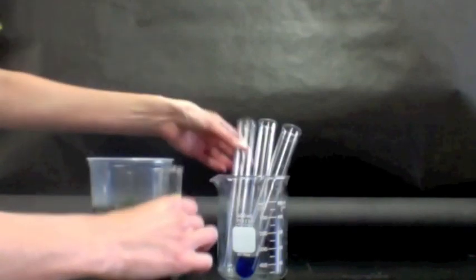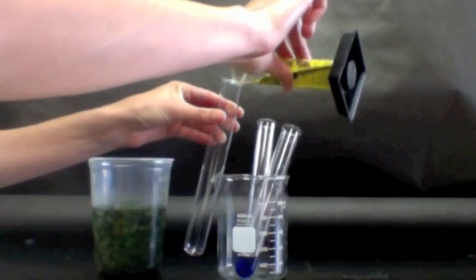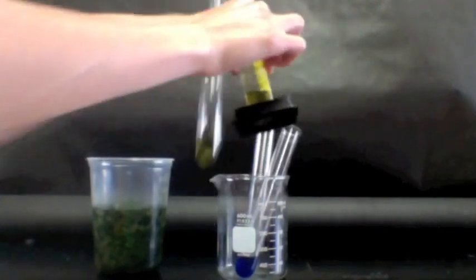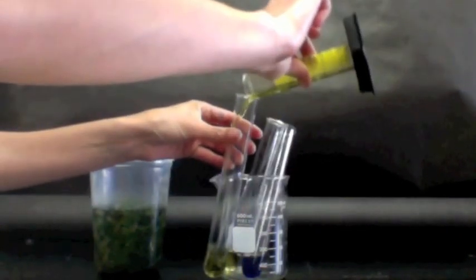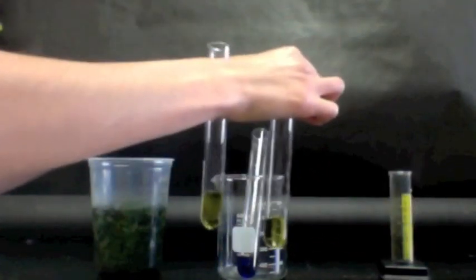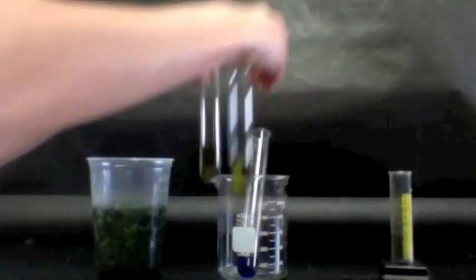So we're going to put some of it in one beaker, one container, and some of it in the other. All right, so now we have two that are yellow and one that is blue.